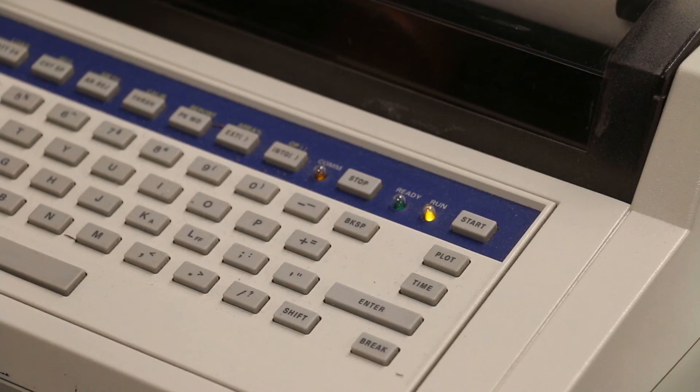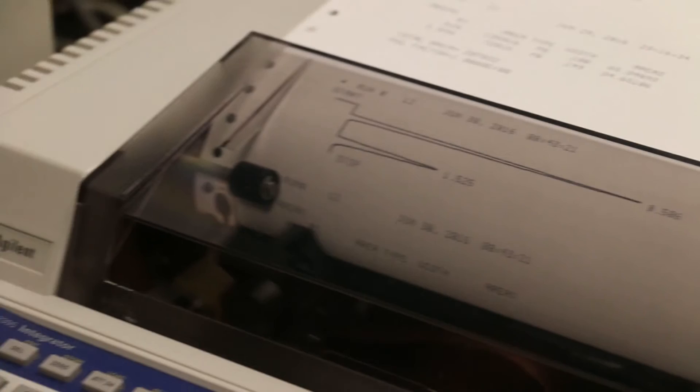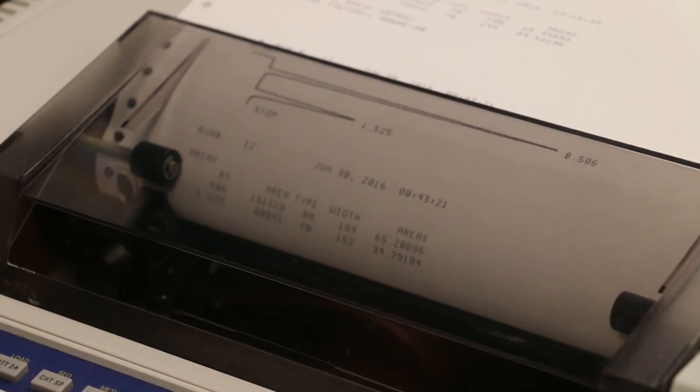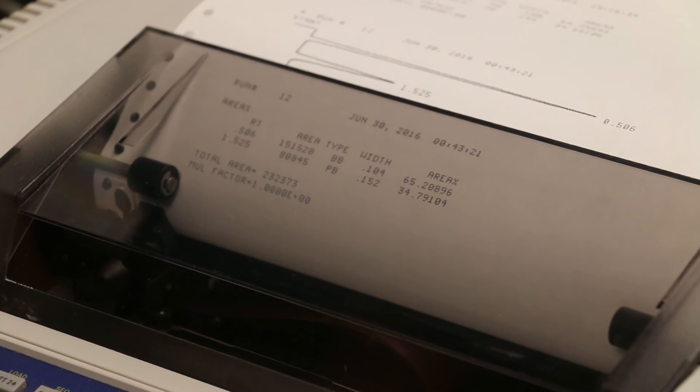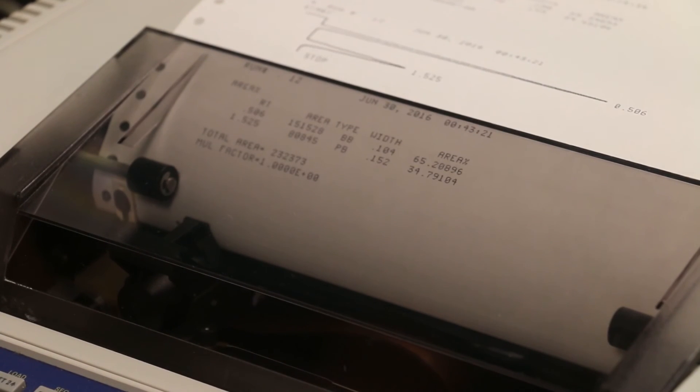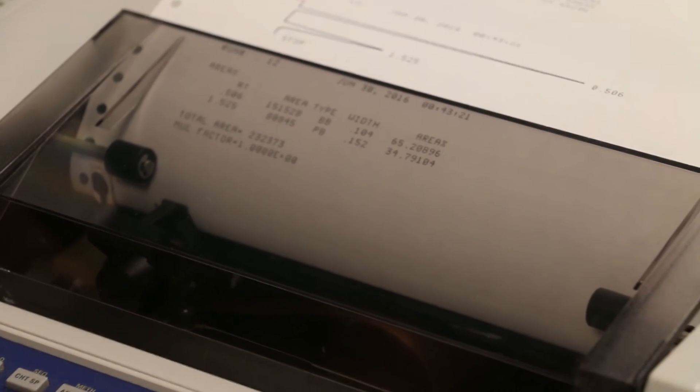The integrator will tabulate the retention times and the areas underneath each peak and calculate the percent area of each peak detected in the mixture.